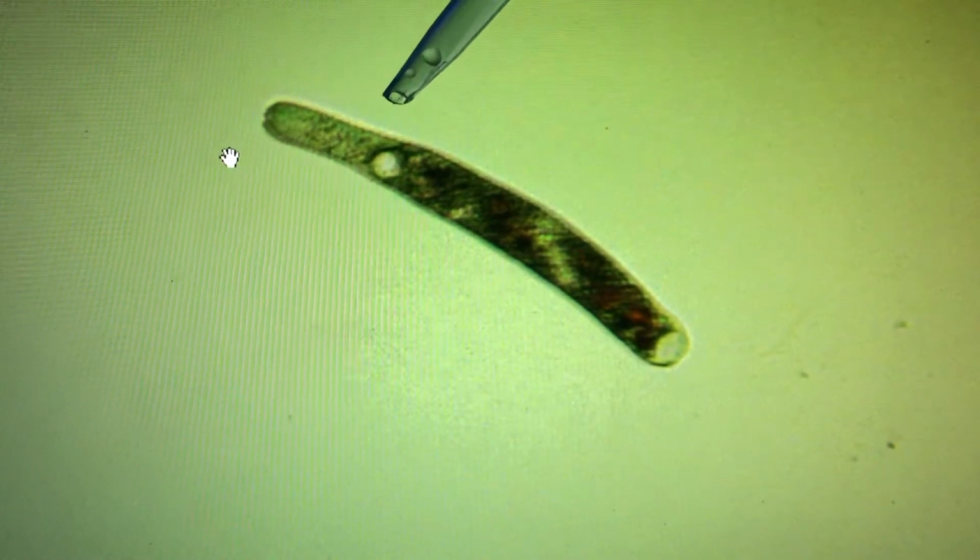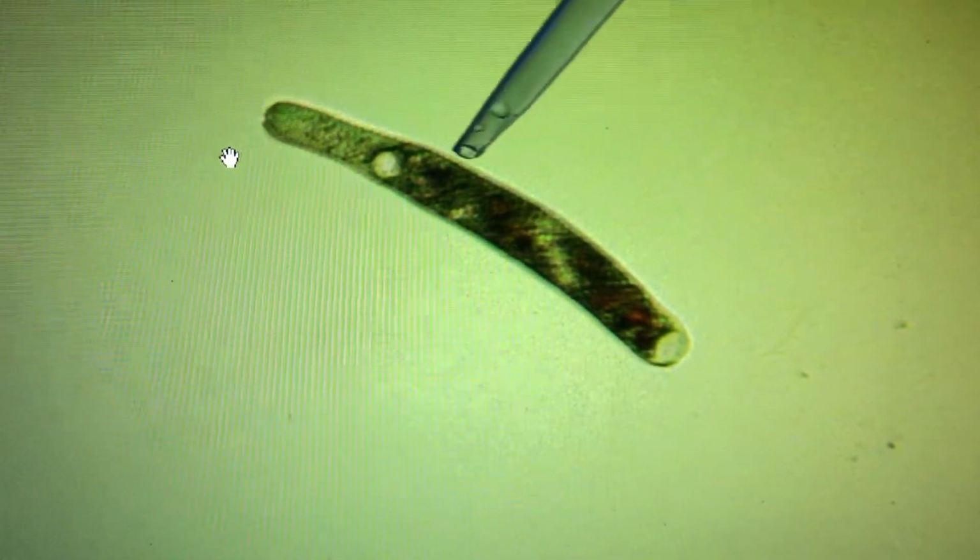Some of the things to note: this is the head of the Philaster. It has a long neck, and it's able to move that neck by twisting it side to side. Typically when the Philasters move through the water, they rotate along their long axis, so they kind of spin around, like a little spinning torpedo as they move. They're able to redirect their bodies to go right, left, up, and down by twisting this neck region. Remember, this whole thing is one cell. This is not a multicellular organism. The mouth of the Philaster is located here.